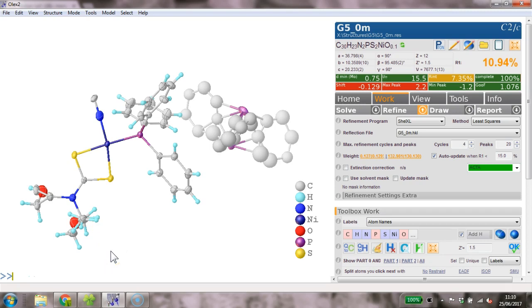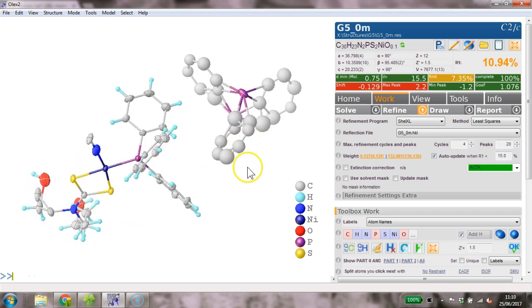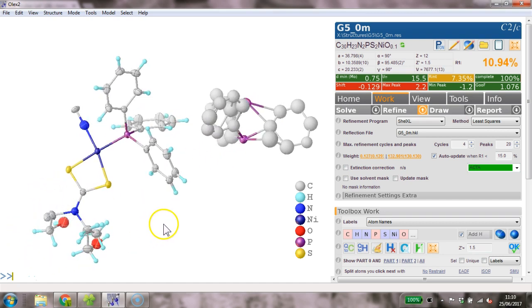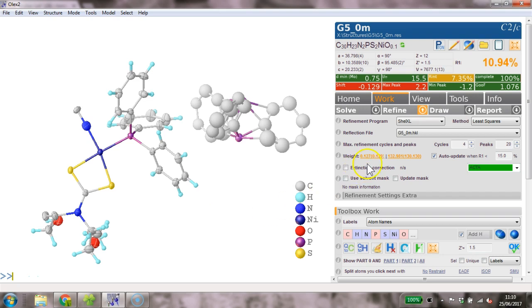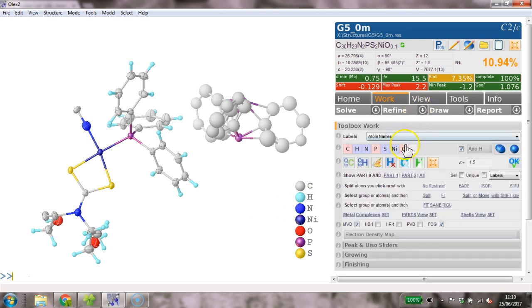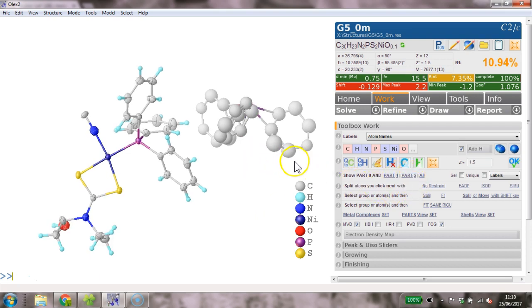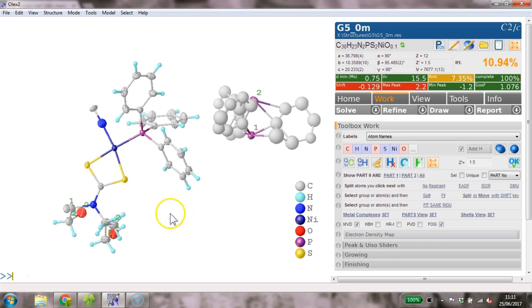Here's an interesting one. We've got some disorder in a triphenylphosphine, and there is some disorder modeled down here. First of all, I would look at what has been done before and look at part 1, part 2, part 2. We can also look at the labels, so we can put the part number on the labels and show all of them. Okay, so there's part 1, part 2, part 2.